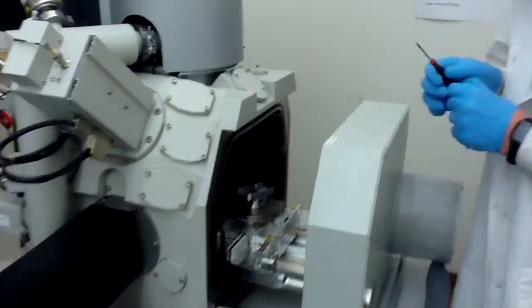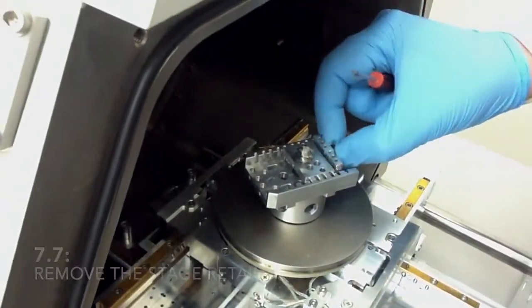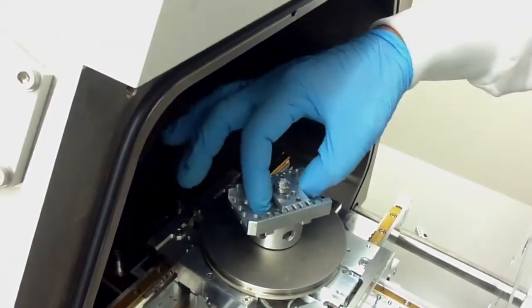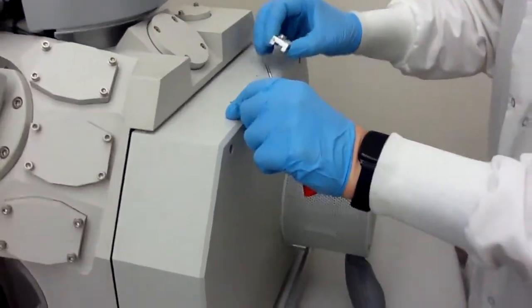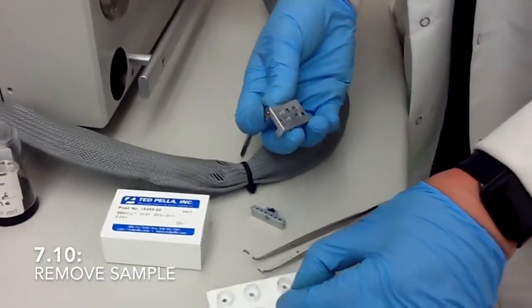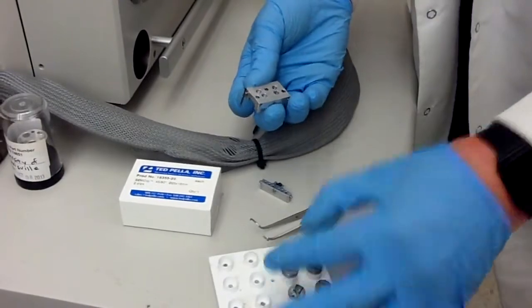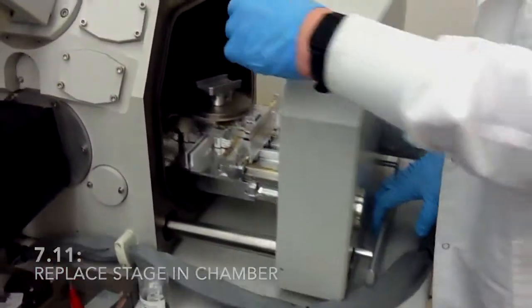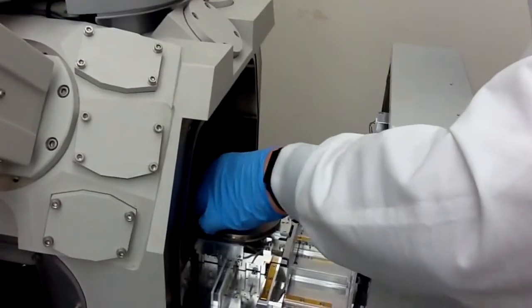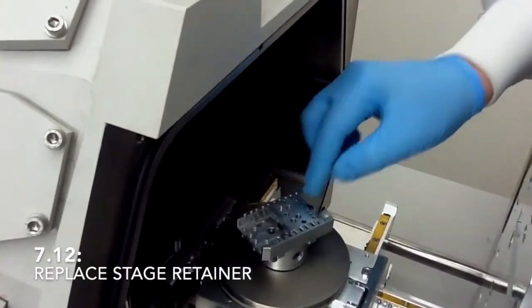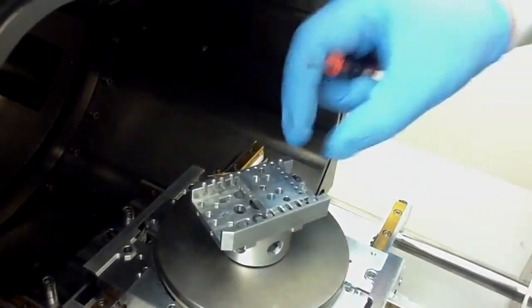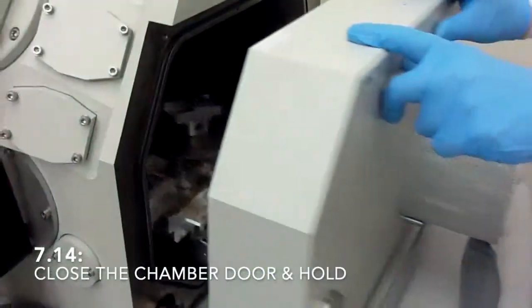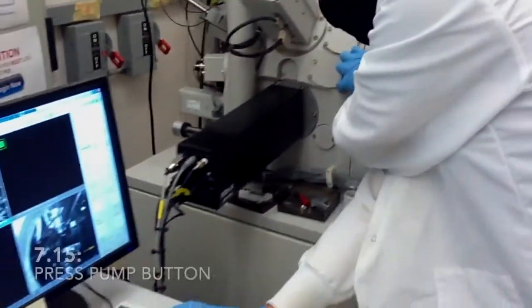Once the chamber has been vented you can open it. Just move gently the door so you have enough access to your stage. Loosen this screw again. Remove this part. Always remember to wear gloves especially whenever you work inside the chamber. Now loosen this screw and just take your sample and put it to the stage. Now this you should always go back to the chamber. It's secure so now you can close the door. Hold it and start pumping.